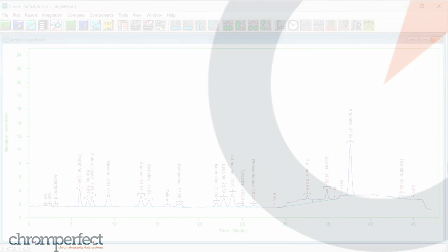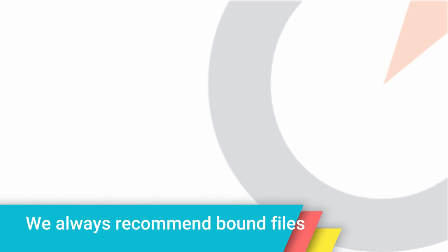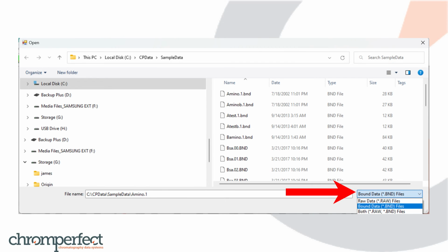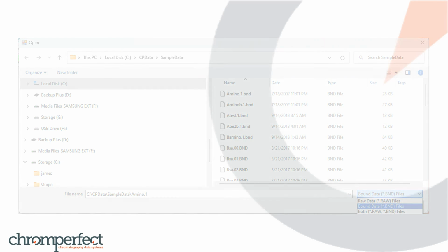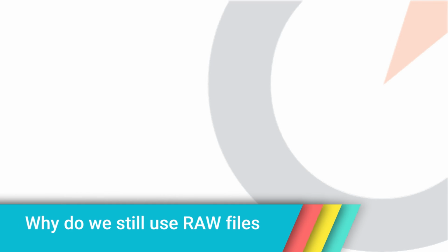This problematic behavior with raw files and methods is the reason we always recommend bound instead of raw files. We strongly recommend that the file prompt within the Analyze program is always set to show only bound files. By default, all Chromperfect methods will create a bound file beside the raw file after every data acquisition run. We strongly recommend that users only use the bound files in their daily operation of the Chromperfect system. In that way, you can be sure that you are referencing the correct plots, results, and reports for chromatography data archive. So why does Chromperfect still offer access to raw files?